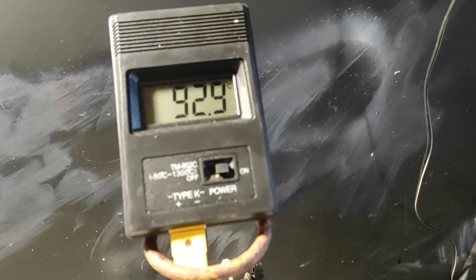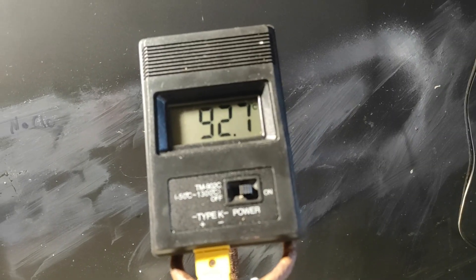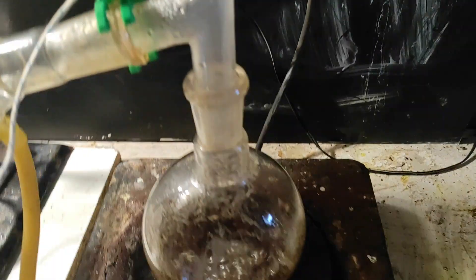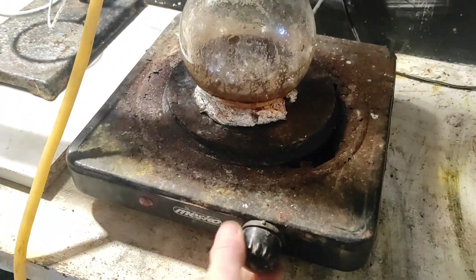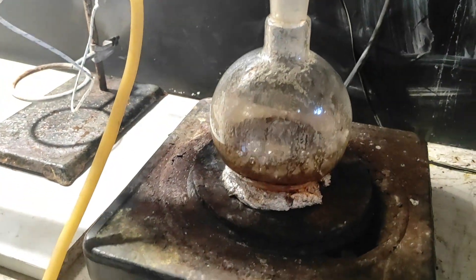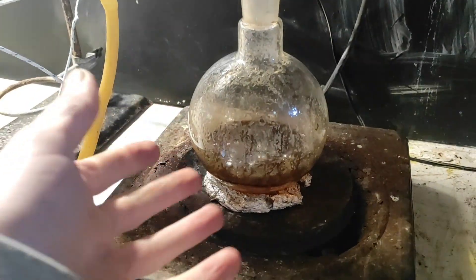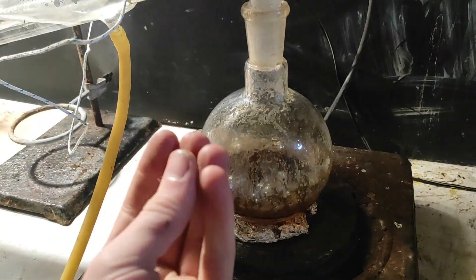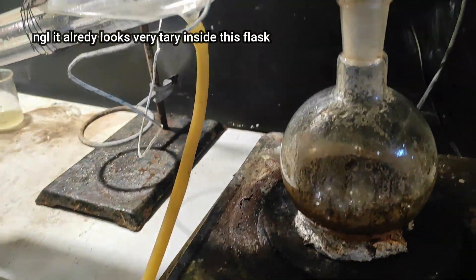And yeah, the temperature is going way up, and now it's going to be just water and all the crap, this thing. So we can just stop here. All right. Because if you boil too much, this is going to make the tar look bad, you know, it's going to be a real mess to clean.